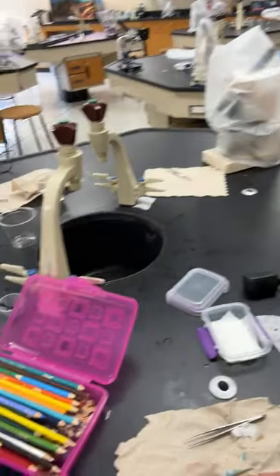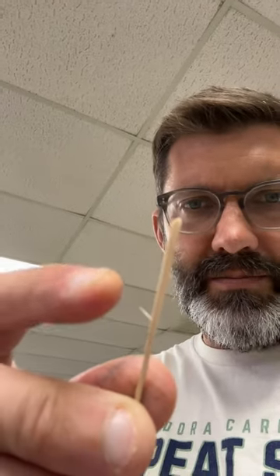By the way, if you don't have a slide or a slide cover on your paper towel, just come and get another one from up here. Mrs. Watts will help you with that. Take a toothpick — see how this one kind of has a pokey thing coming out already, so remove that. That way it doesn't lodge inside of your mouth.